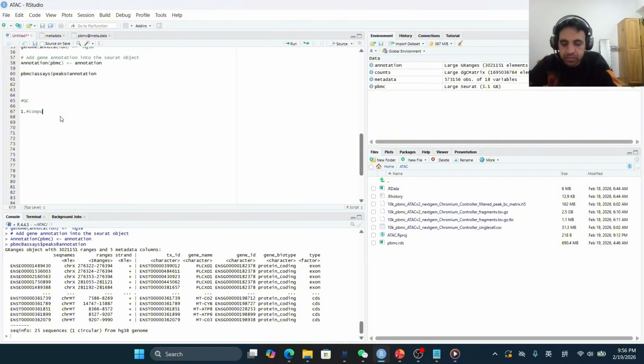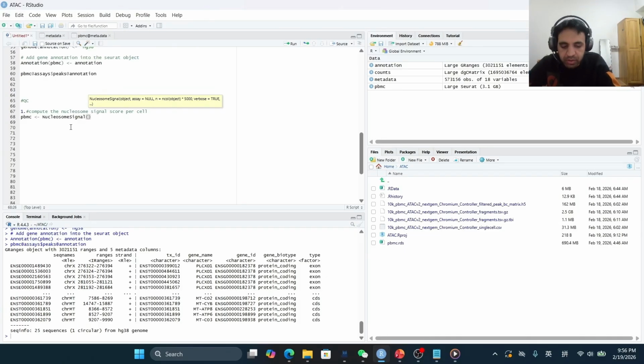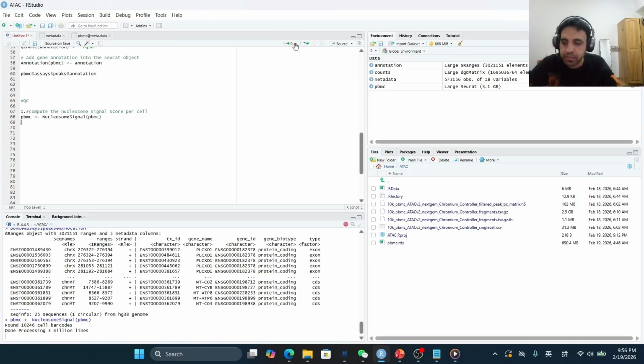So compute the nucleosome signal score per cell. So we will use the given line of code, PBMC, which is our Seurat object, and we will use the nucleosome signal function from the Signac package. Run. This line of code will compute the nucleosome signal score for each cell. It will take some time because there are a lot of cells.